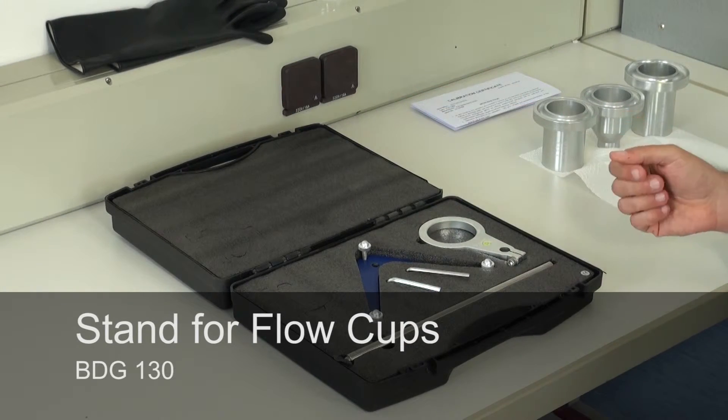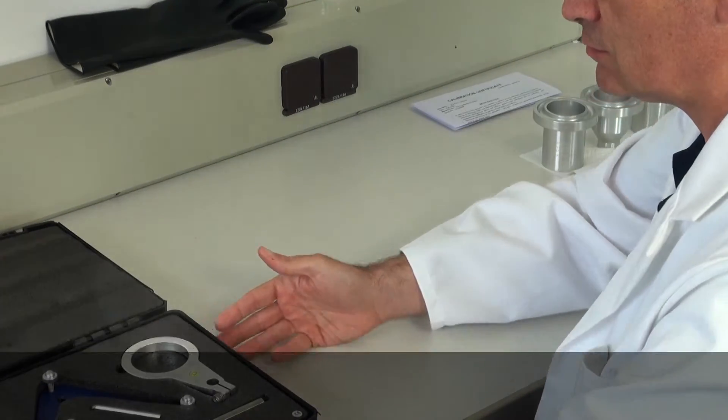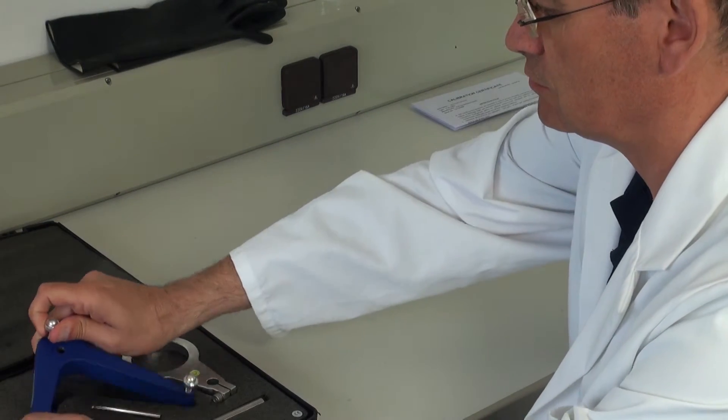The stand is delivered in a practical case. To assemble the stand, first of all the stand base has to be removed.